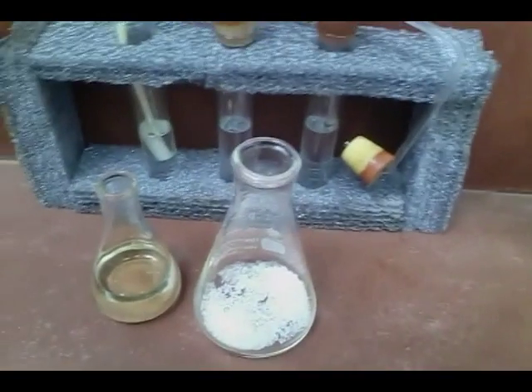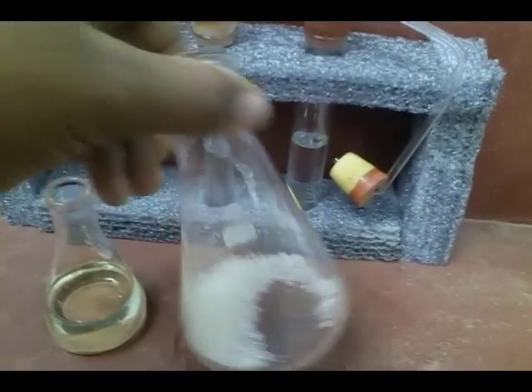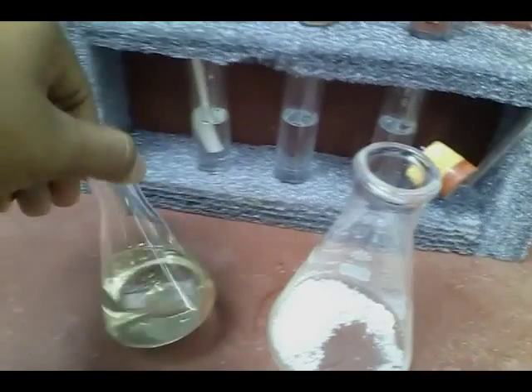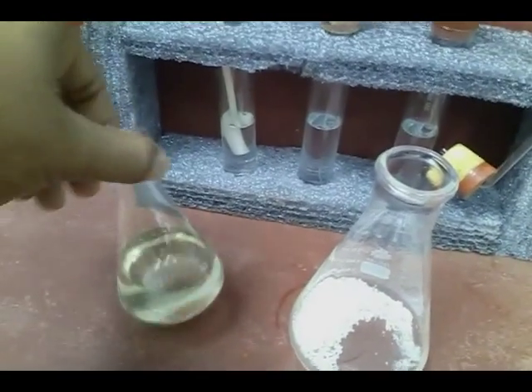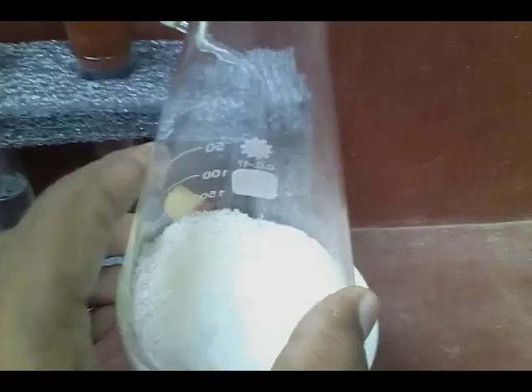Hello YouTube. In this video I show you how to make oxalic acid. We need 10 grams of sugar and 55 milliliters of concentrated nitric acid. In these three boiling tubes there is potassium hydroxide solution. First I put nitric acid into the sugar.